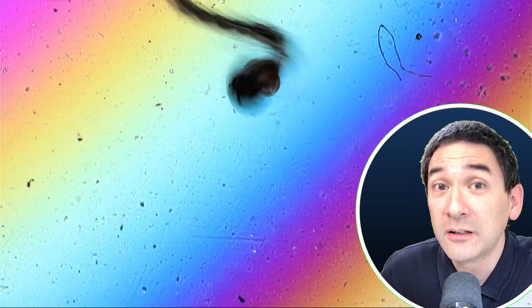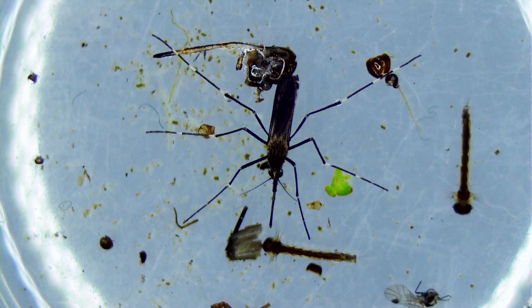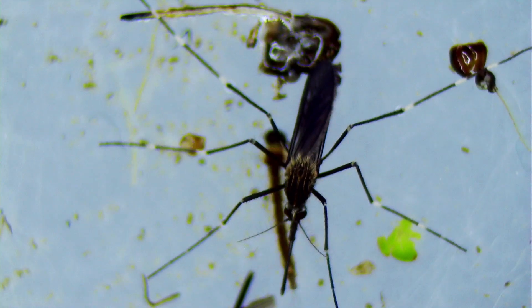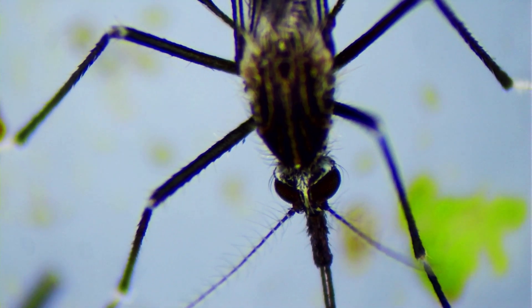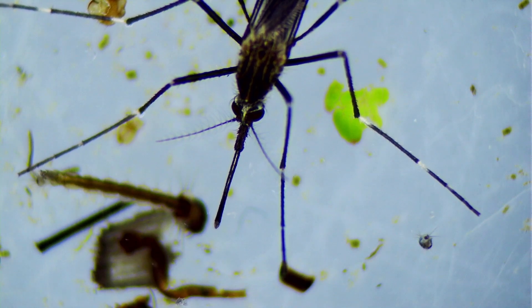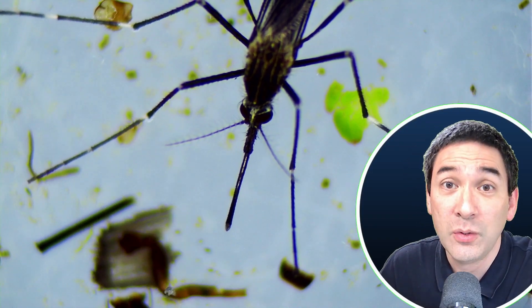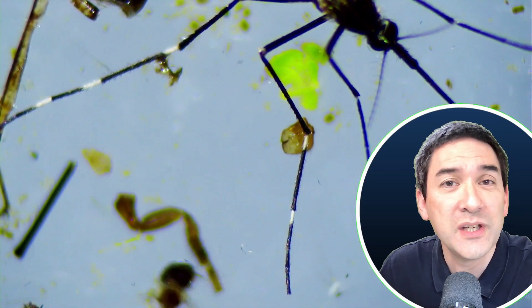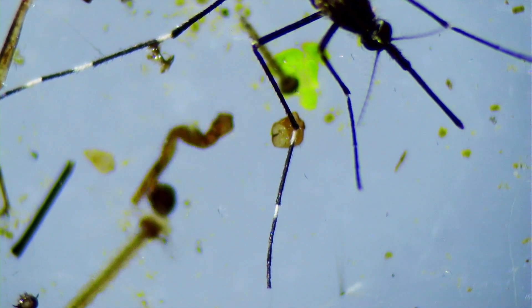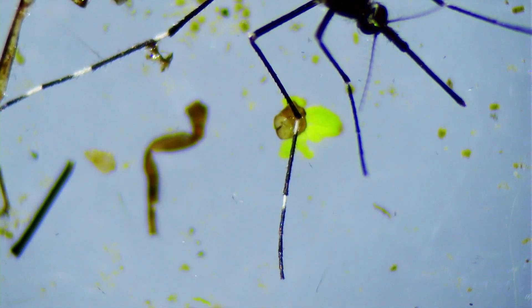I'm also going to try to mount an adult mosquito, because after one day already the first mosquito started to appear. I removed the lid of the petri dish, and it came out from its pupa — those larvae form pupae and there is something called metamorphosis going on. The larva changes into an adult insect, which then sits on top of the water surface waiting to dry, then flies away, mates, and the life cycle is completed by laying eggs again into the water. I noticed that the legs have interesting white stripes, which can serve as an identification characteristic. However, there are so many mosquito species and I'm not an entomologist, so I leave it up to you to identify this species.